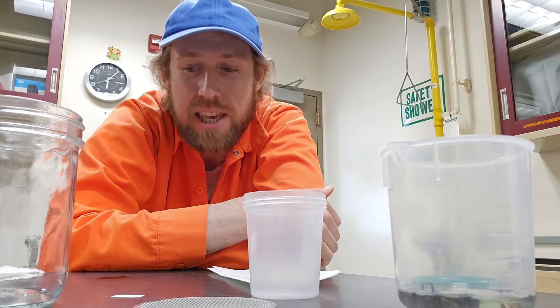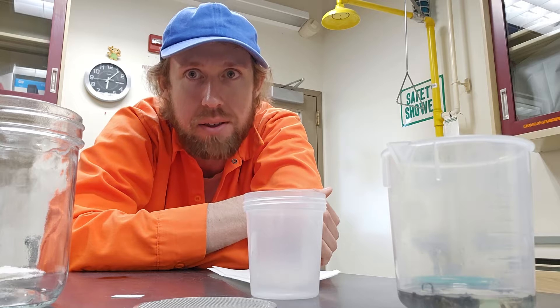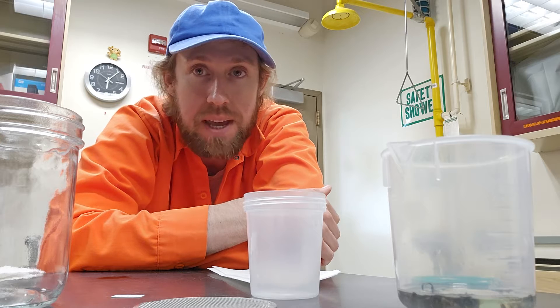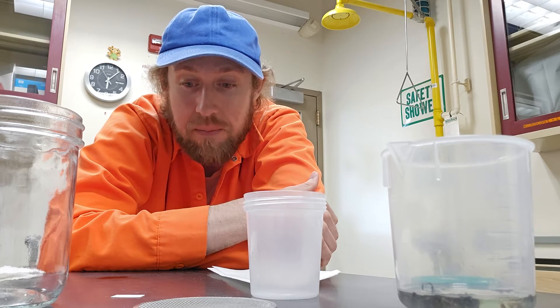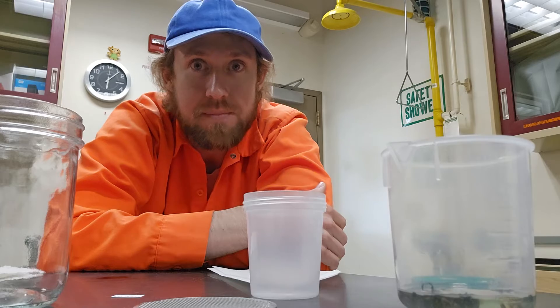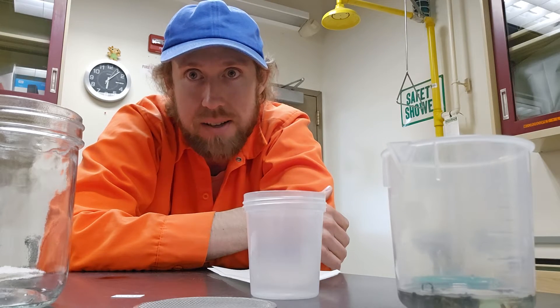If you've seen any of my past videos, there's been a variety of other methods that can be used to wash and dry bees with the idea of getting them nice and fluffy to be pinned on a specimen. Normally the previous methods have involved actually washing them with soapy water, and then when they're all wet it's more of a challenge to dry them off.